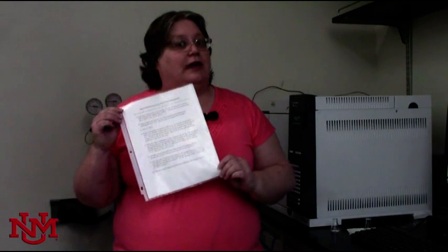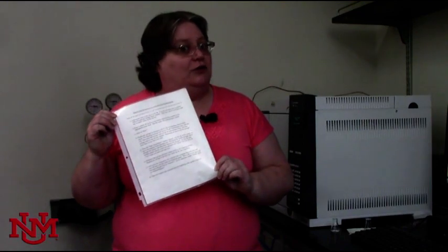All right, how do you actually use the GC? The steps are written down in clear, easy to understand English. We will go through the process.